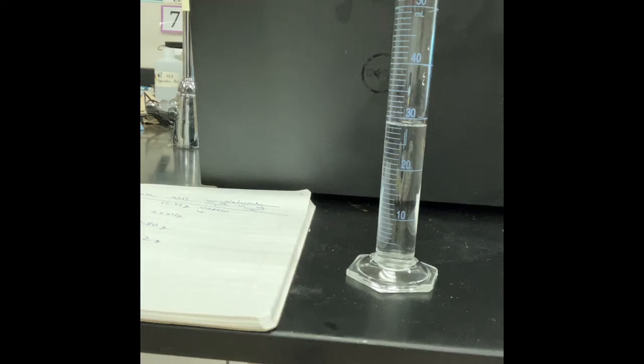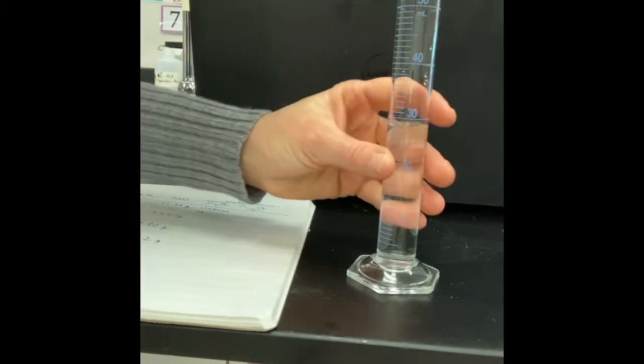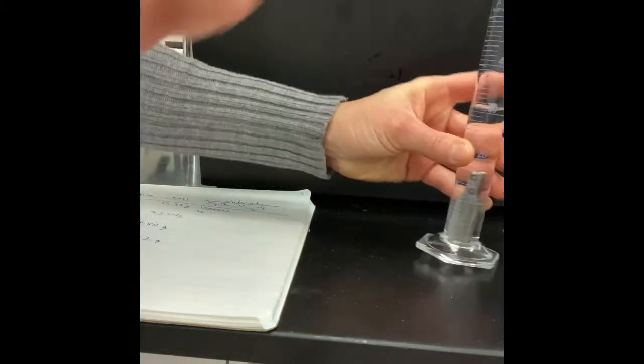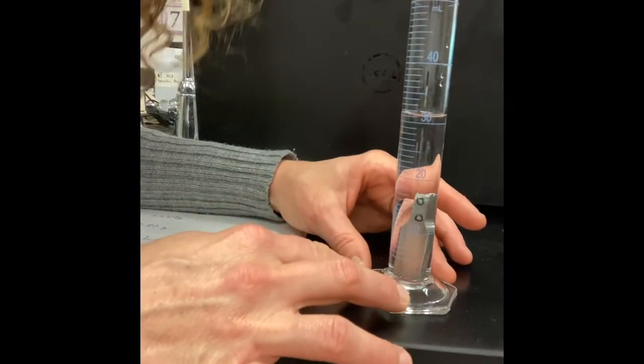Then I put my sample in. So I'm working on titanium. That's where I am in the little notebook. So I have a little metal sample here. Since this graduated cylinder is glass, I'm going to be real careful with how I add these metals. I'm just going to let it kind of slide in. We're going to hope we don't break anything. All right. So my sample of titanium is in there. This is the same one I weighed.